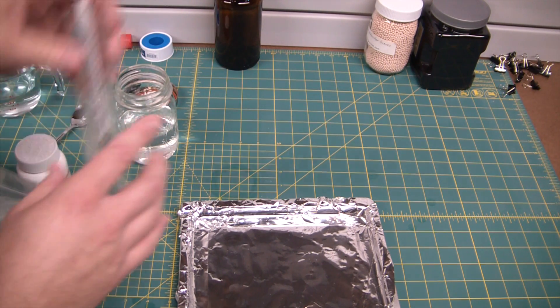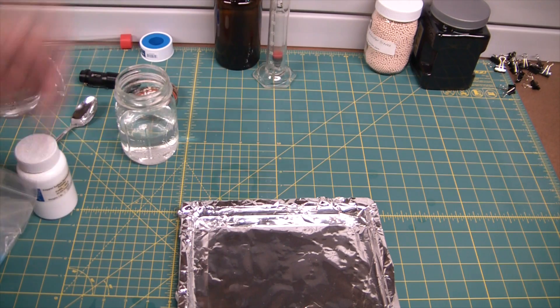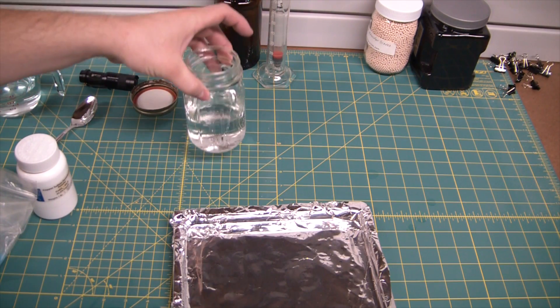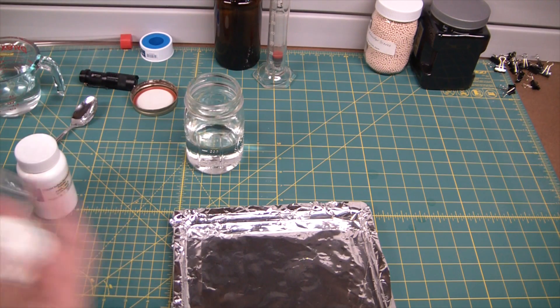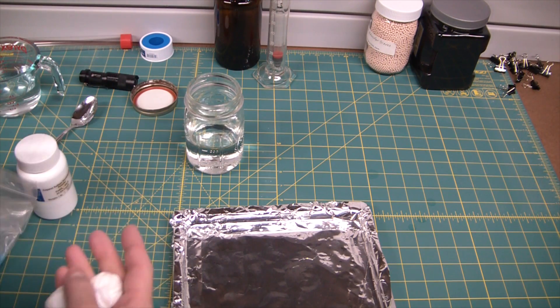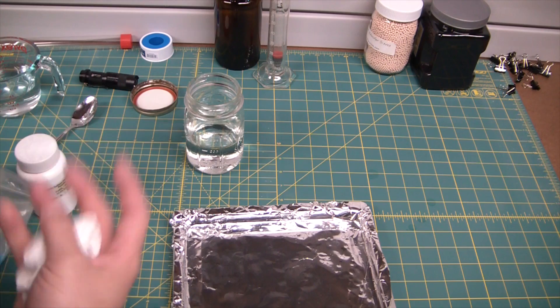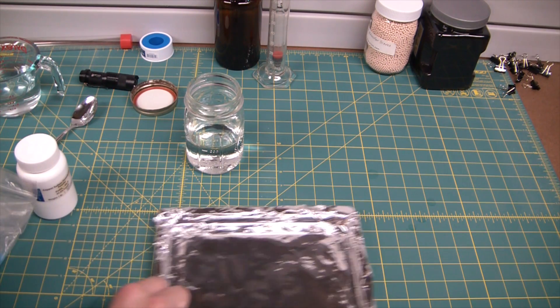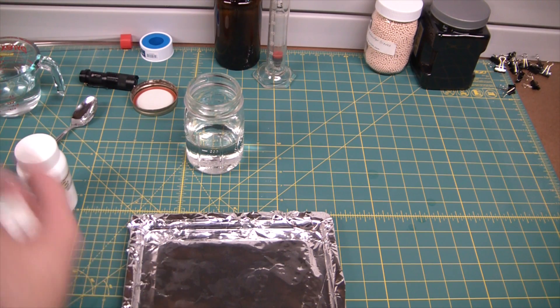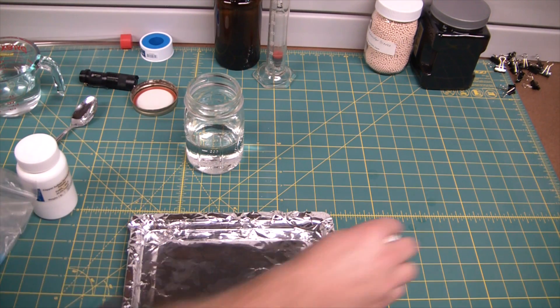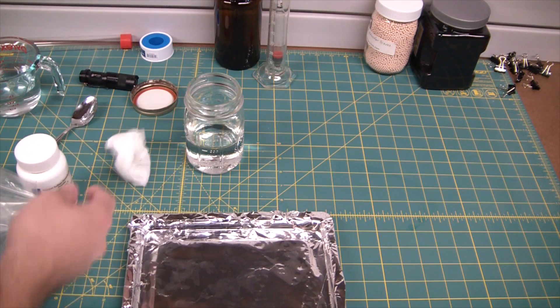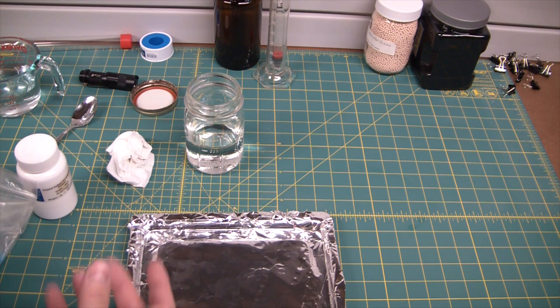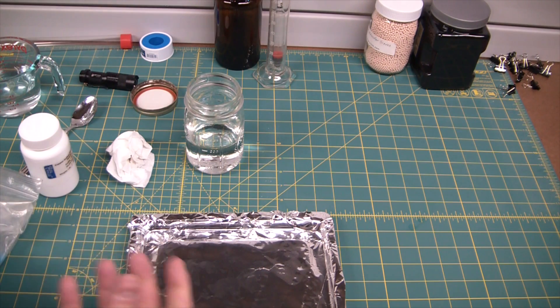And that is our percentage, not proof. Proof is double the percentage. So to get this fully dried now, what we're gonna have to do is desiccate the water out of it so this could be distilled to a higher level of purity. The azeotrope is at 95%, and at that point the ethanol will actually pull water over with it, keeping its percentage at 95. So by distillation only you can't break above 95% pure ethanol.